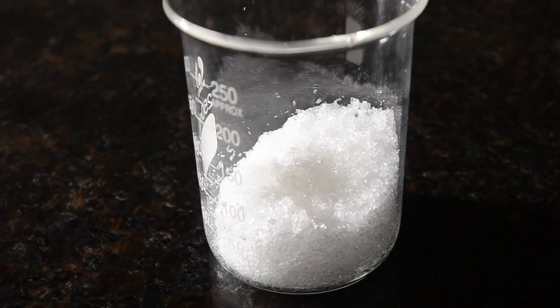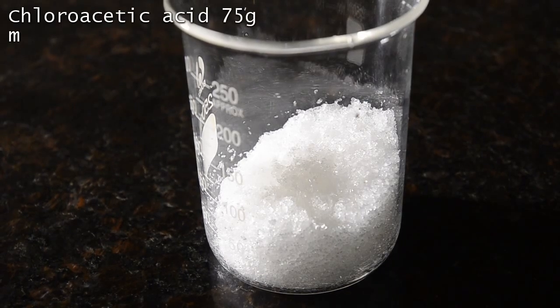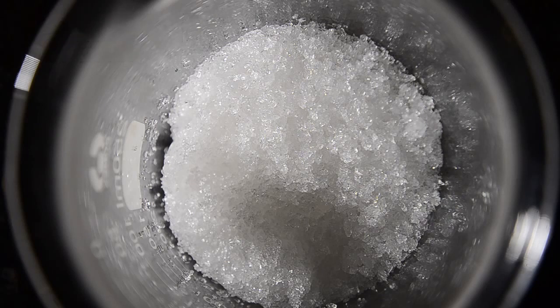Today we'll be preparing an ester, ethyl chloroacetate, and trying out an experimental way to make ester synthesis more efficient. To start, we're using the corresponding carboxylic acid that we require, chloroacetic acid, which as you can see is a crystalline solid. Be careful with this because it's quite toxic and a metabolic poison. Don't get it on your fingers.